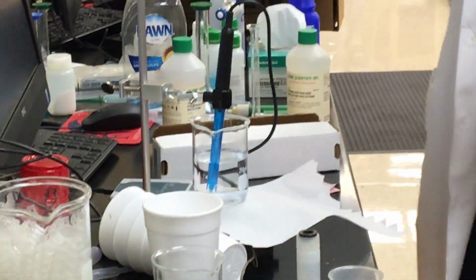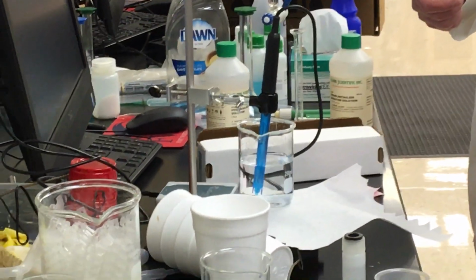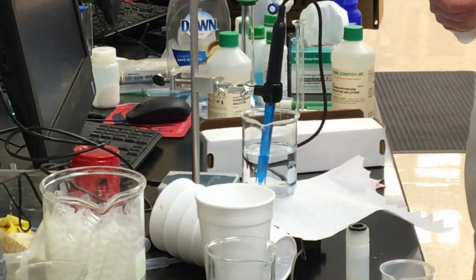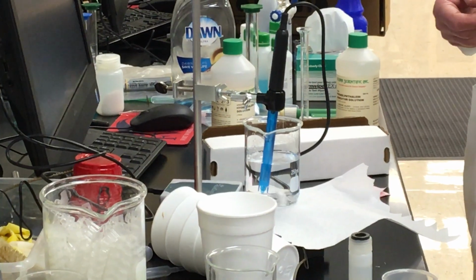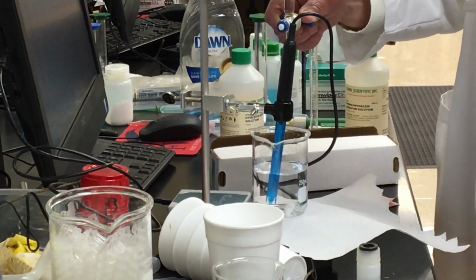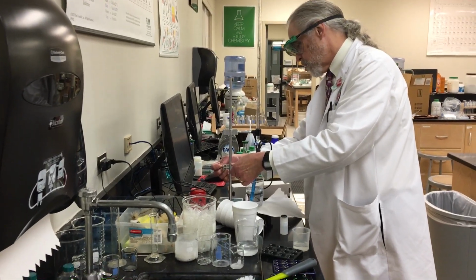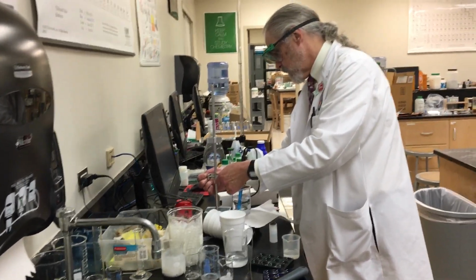I think I have way too much acid in here. You're going to need more. I think I am, which is not what I wanted to do. And now I'm going, what was I thinking? That's way too much acid. I'll tell you what we're going to do. We're just going to pour some of this out.